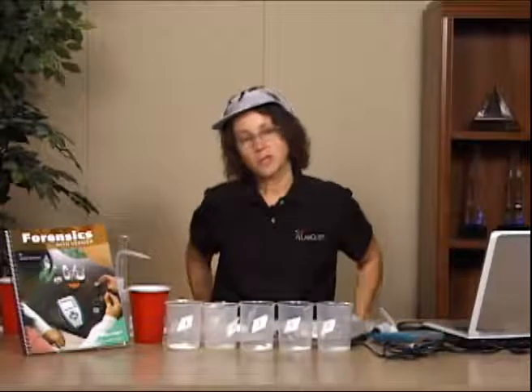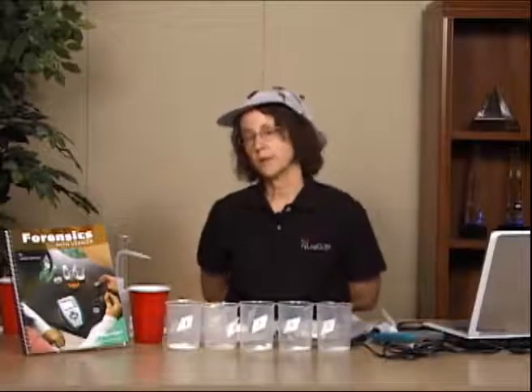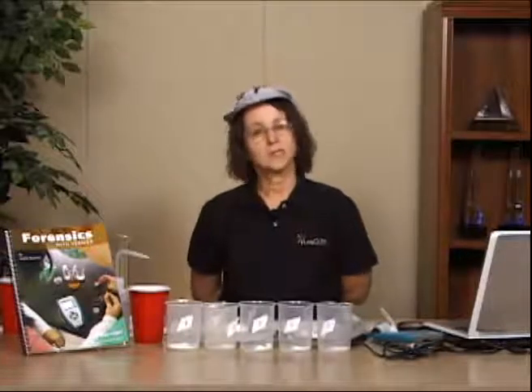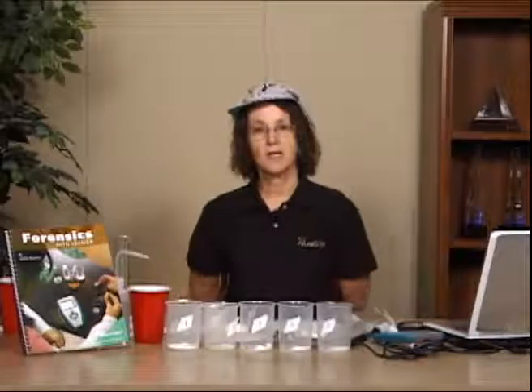It's a lab that does drug testing, and it's doing a little bit of qualitative analysis. And all of the labs in that particular book are going to give us a scenario, and that scenario gives us a setting for the lab.